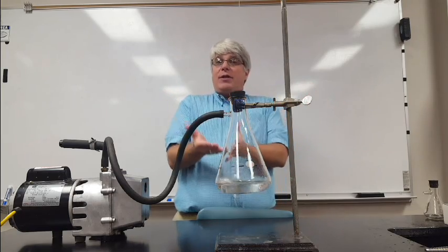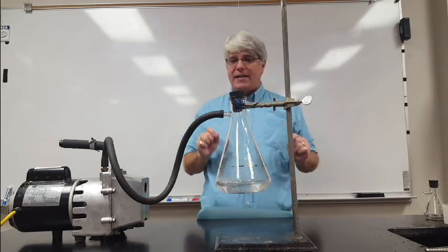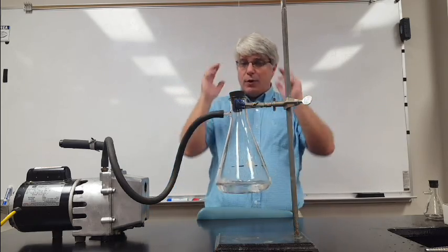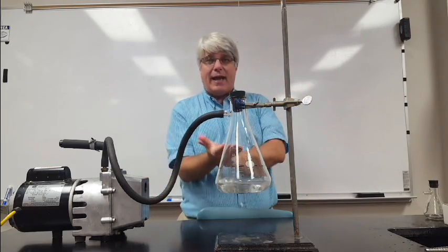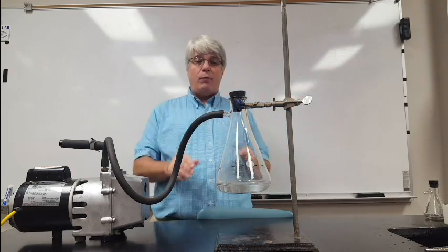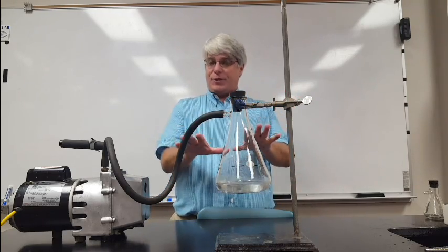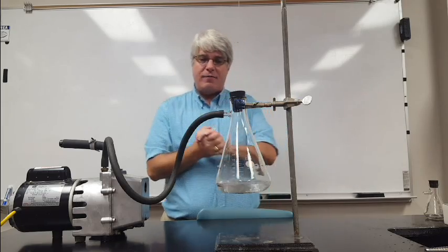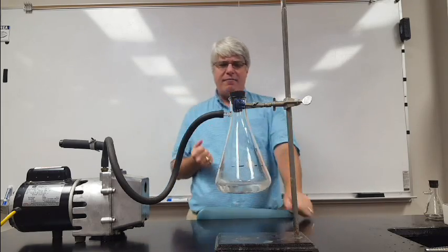So I've actually reached the boiling point even though I haven't heated this up because I've reduced the pressure. You can reach the boiling point of a liquid by heating it—that increases its vapor pressure—or you can reach the boiling point by reducing the external pressure so that the external pressure eventually matches the vapor pressure.